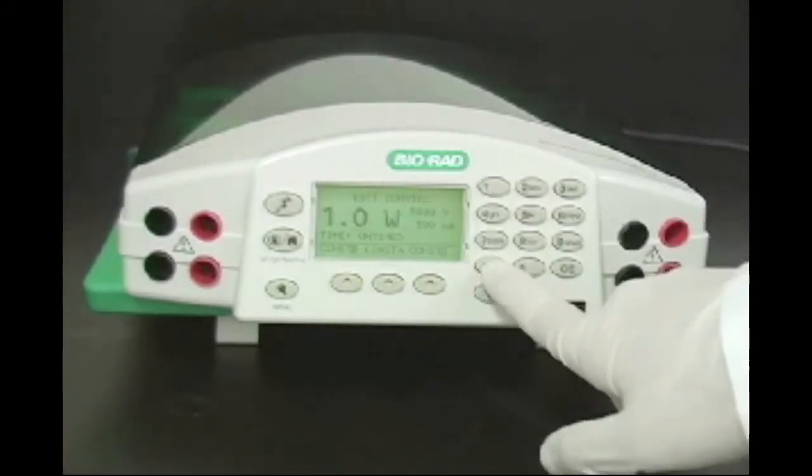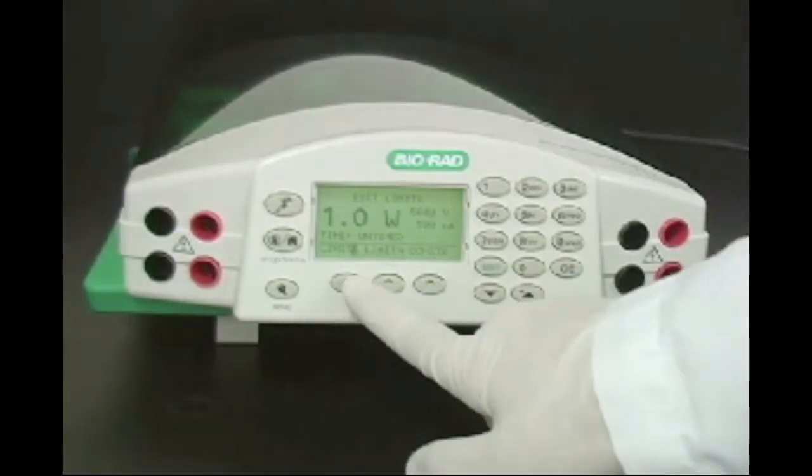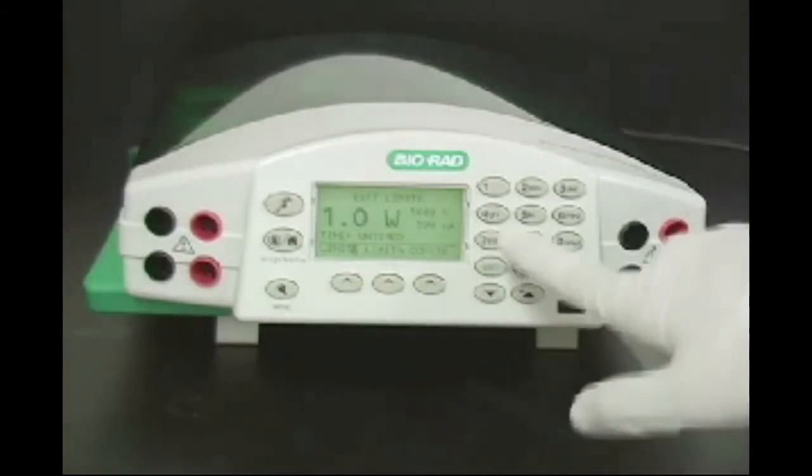For this protein sample, set the power supply to 1 watt constant power and set the voltage limit to 1000 volts.